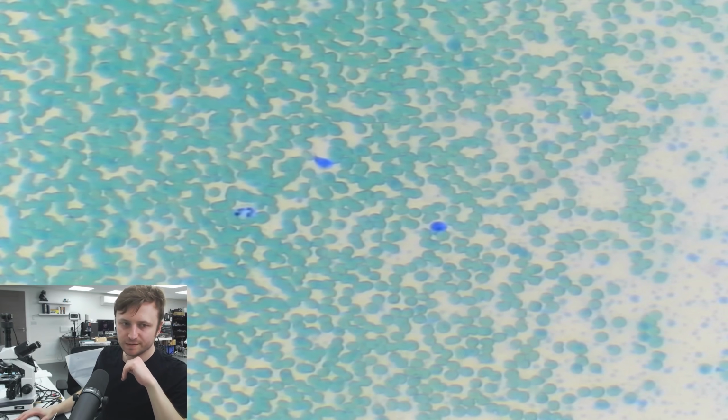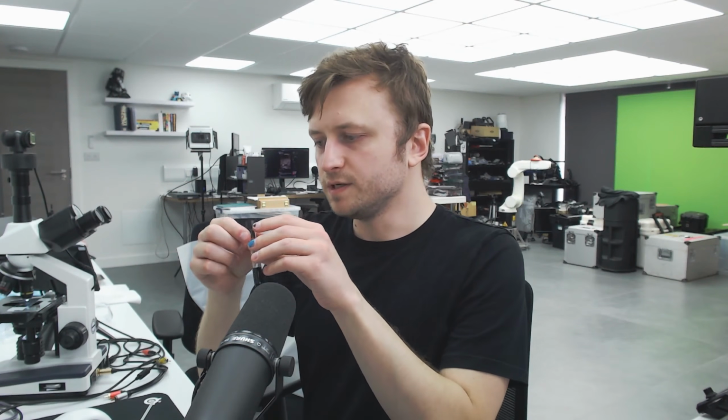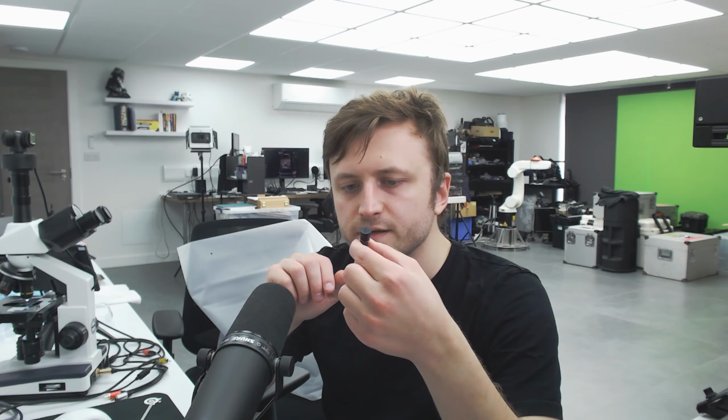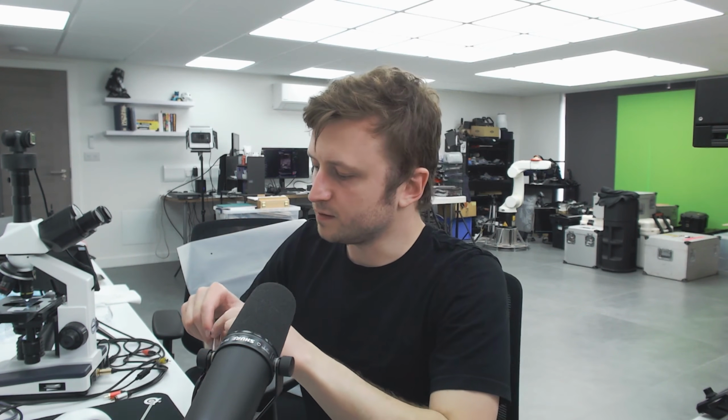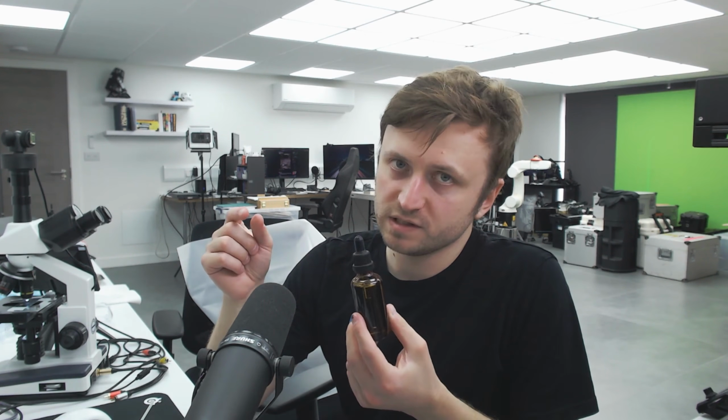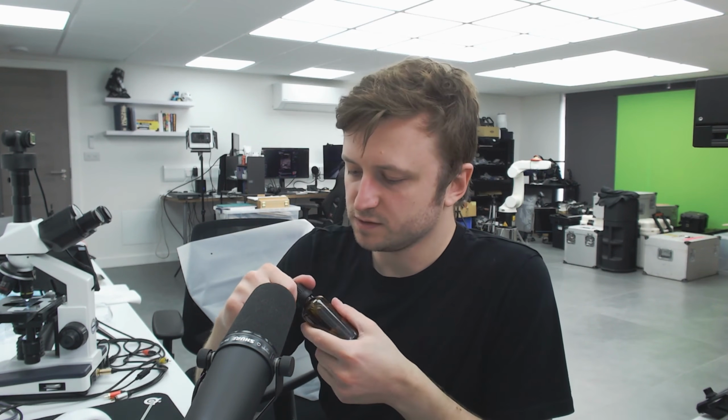Oh, let me show you the stain as well while you're here. Hang on. Alright, so this is methylene blue, which has been diluted a little bit. Still kind of freaky to touch though. So this goes on after the slide has been prepared with a fixative. The fixative in this case is isopropyl alcohol, as I mentioned. So this is just distilled water, but I have the isopropyl in a similar dropper tool. So I just drop it onto the slide and then I just let the subject bathe in whatever it is, whether it's the fixative or the stain, for a few minutes. Then I rinse it off, let it air dry, and then check it under the microscope.